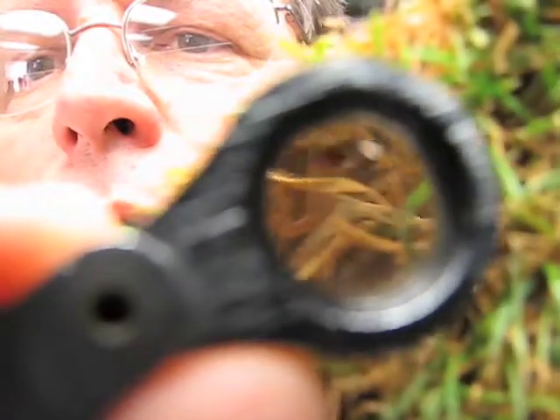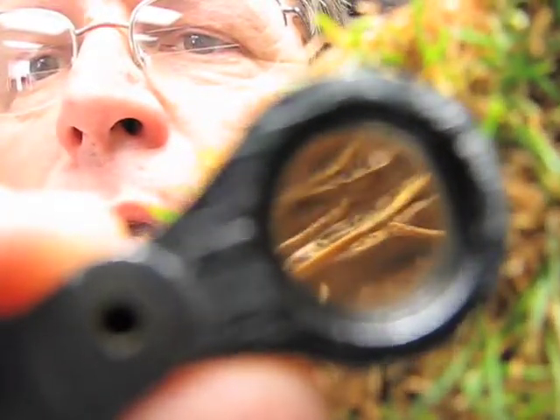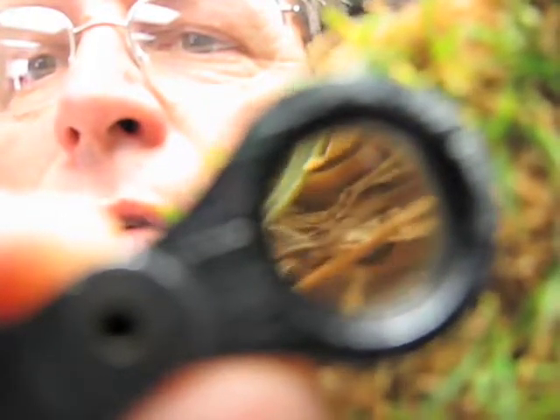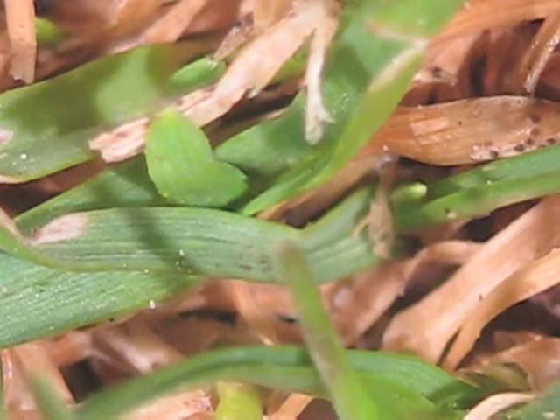And what we're looking for are some small dots on the foliage. These dots don't look like much in this magnification, but we're going to take a little bit closer look under a dissecting microscope and then a compound scope, and they're a little bit interesting to look at, not quite like anthracnose.